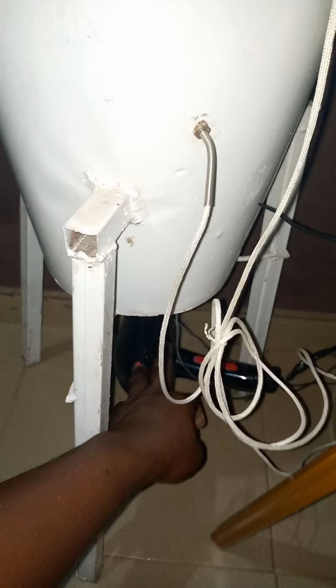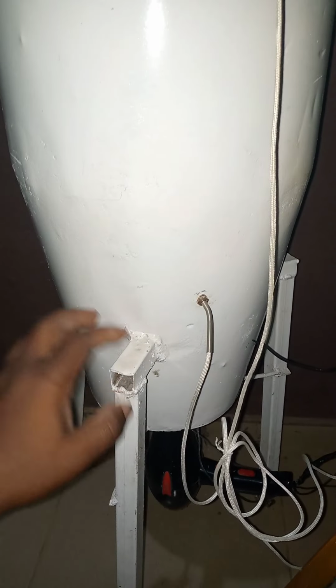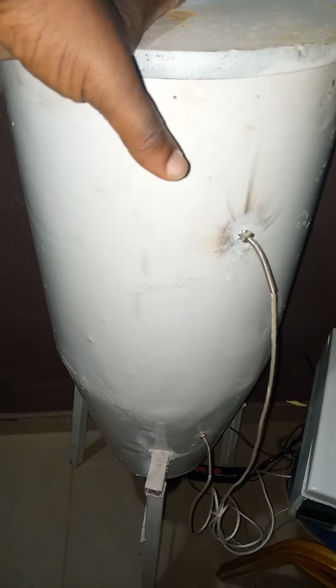This is a dryer blower that has been attached so that it can supply inlet hot air. Please be aware that this is developed as a prototype to test the functionality of the model we have designed.